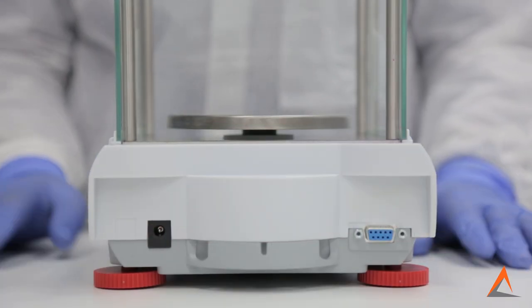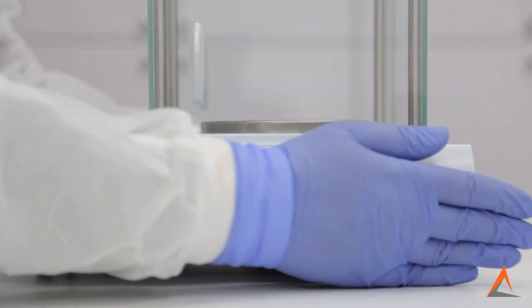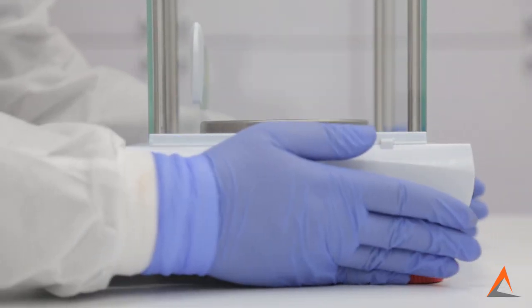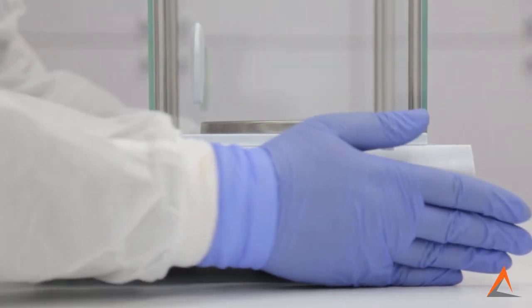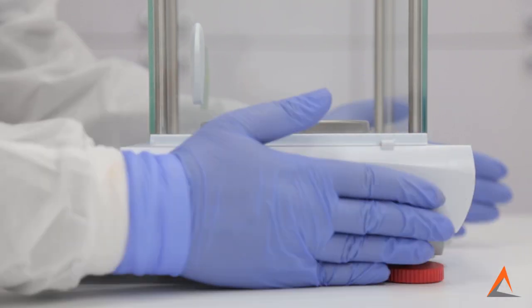The balance that I am using has two adjustable feet in the back. However, there are some models with four adjustable feet. These adjustable feet will allow you to adjust the height of the balance and in turn allow you to compensate for any minor imperfections of the countertop.